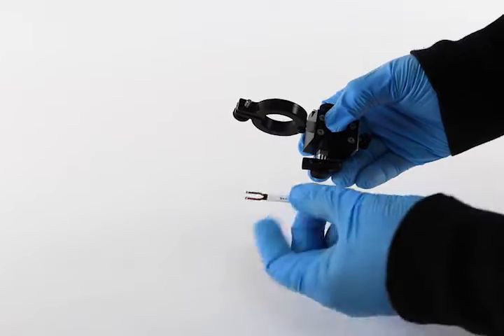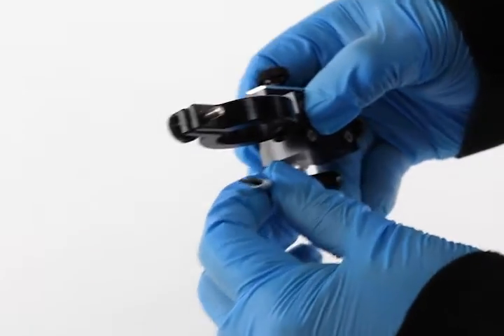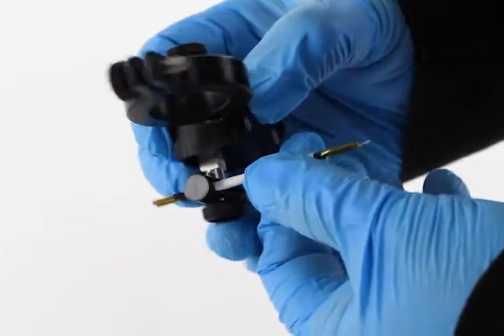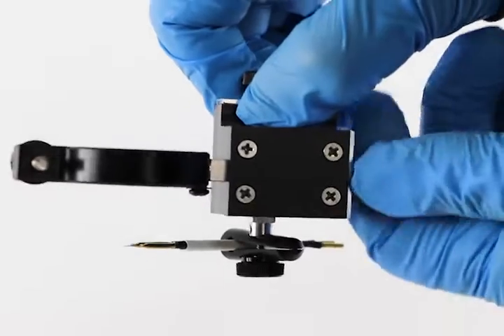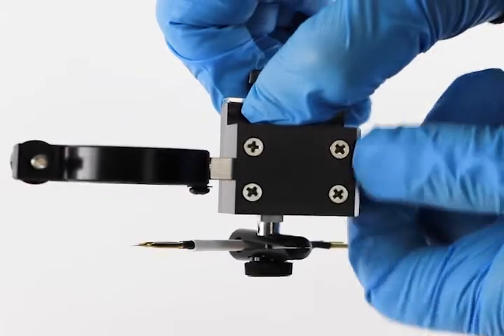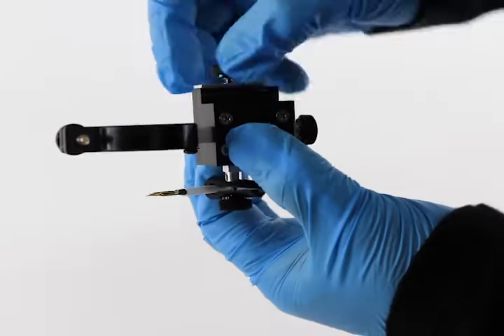Mount and connect the heating filament. Push the filament into the clamp about halfway with the filament under the objective clamp. You can adjust the position of the filament up and down and laterally in relation to the objective.